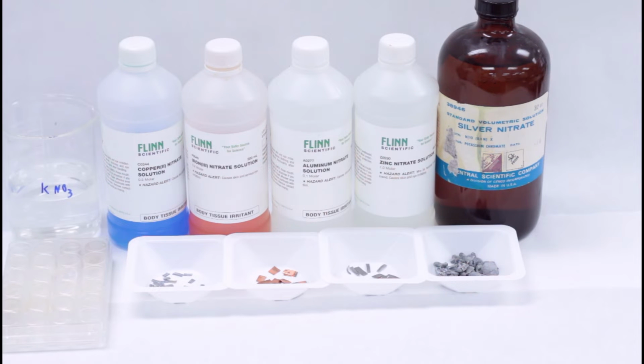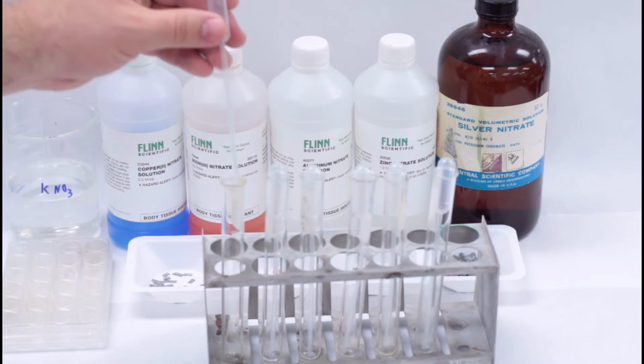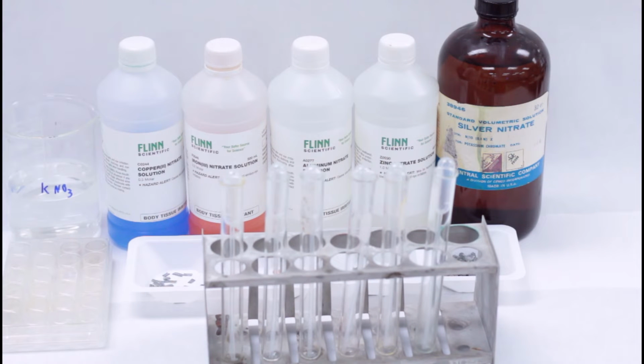This is another lab where the exact chemicals used may change year to year, so verify with your instructor which solutions and metals will be used. Regardless of which chemicals are used, you'll have 6 solutions and 4 metals. You'll need a microwell for the analysis. You'll collect the solutions in 6 medium test tubes using 1 pipette for each test tube.